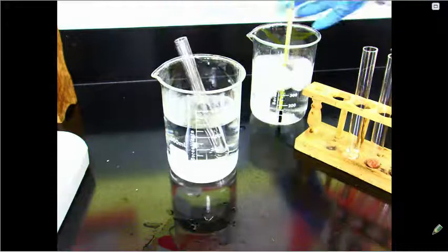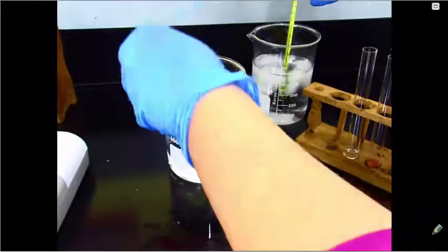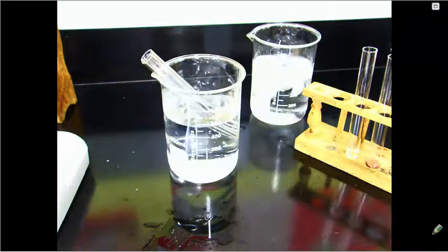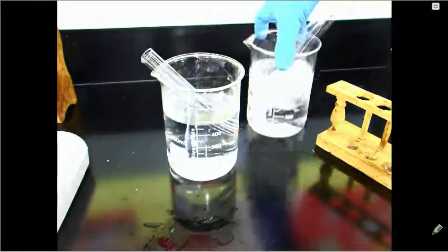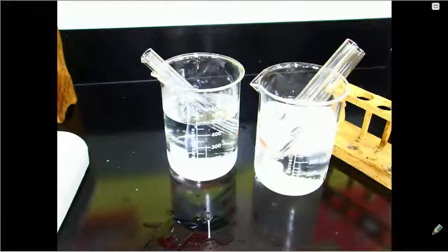It is right around, oh, it's still going down. Still going down. It's right around 10 degrees Celsius, a little bit below that. So we have a test tube of hydrogen peroxide and a test tube of liver in each of these water baths. Now the warm water bath, that is not hot. It is just warm water, a little bit above room temperature. And we'll let them sit in these water baths for about 3 minutes.